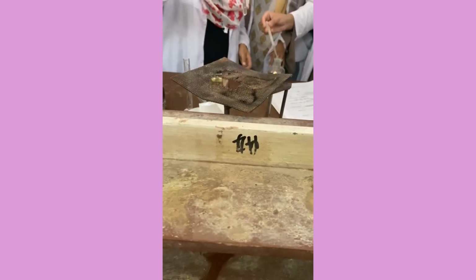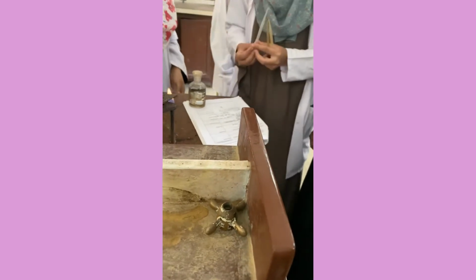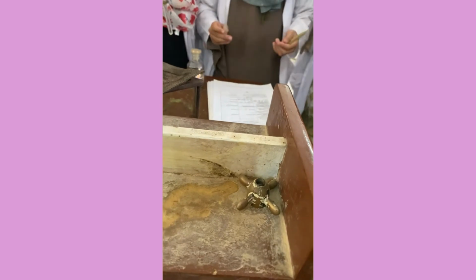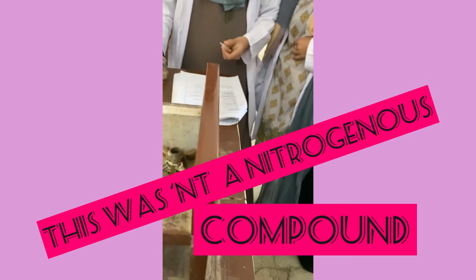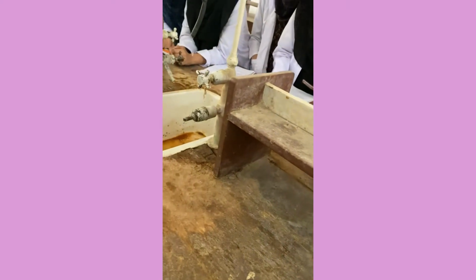This is the last experiment. Nitrogen is not there. They are doing it. Very good. Yes, ma'am, that's correct. Very good. Thank you, ma'am. That's great. Well done. It's a non-nitrogenous compound. Then we have to do the next test, the sulfur test. Go for the other test.